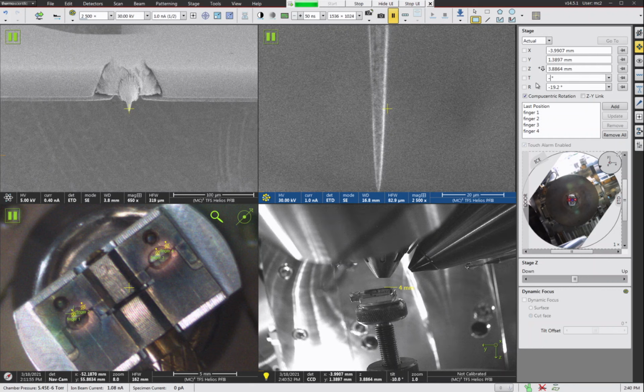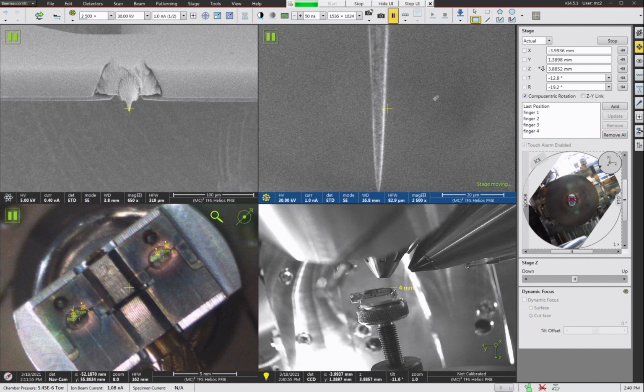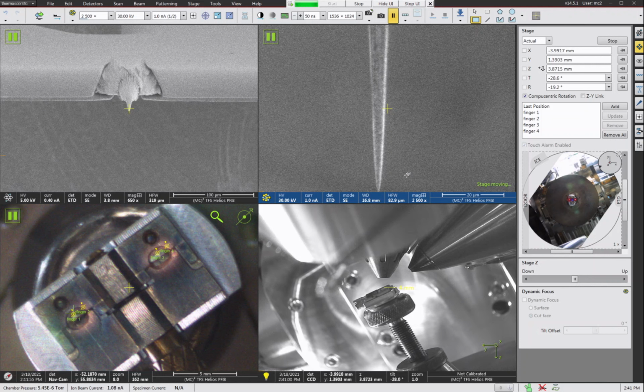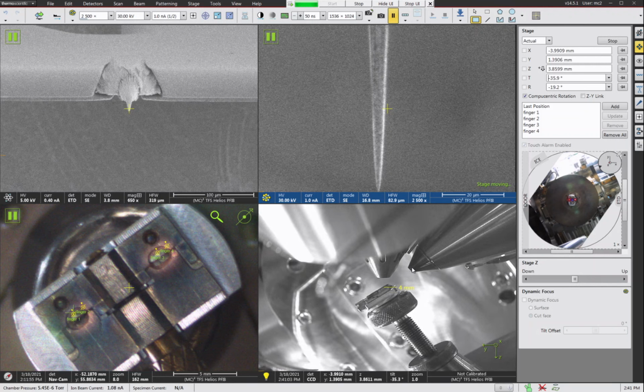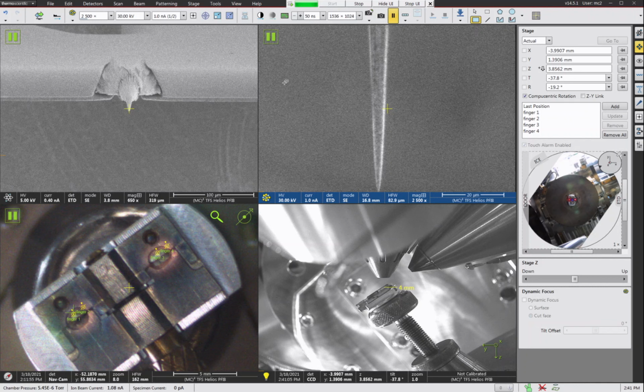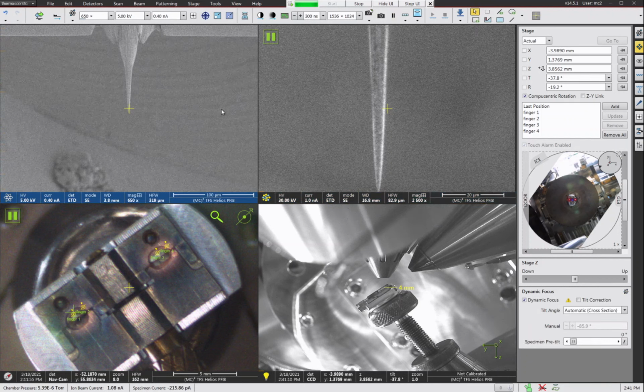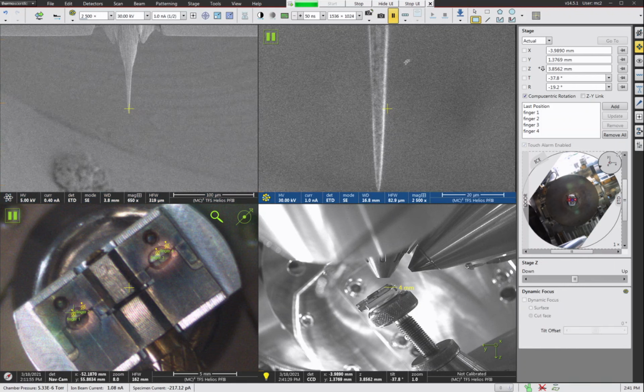So now we can choose minus 38, and we can back tilt the stage to make the sample perpendicular to the FIB. Now, there is a really, really important safety concern here. For some reason, when ThermoFisher wrote this software, they didn't think about the fact that in the FIB image, if you double click, the stage tries to move really, really fast, either away from the FIB or towards the FIB. And you've got to be really careful on this.